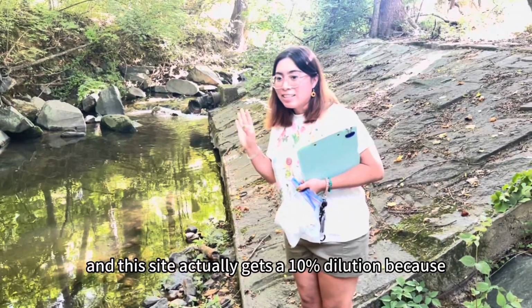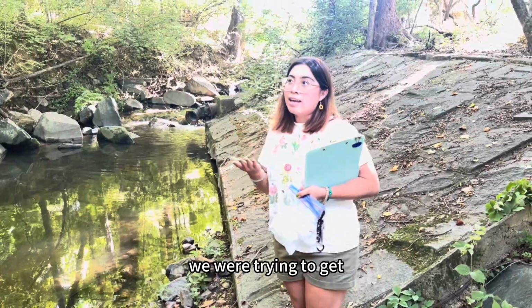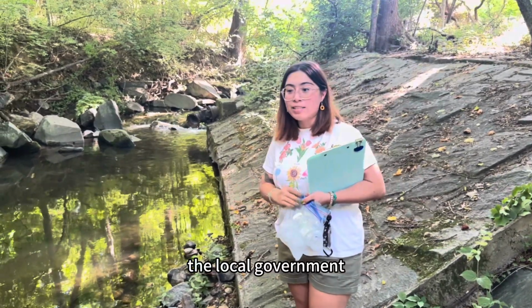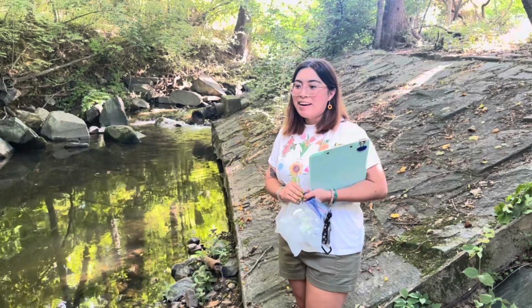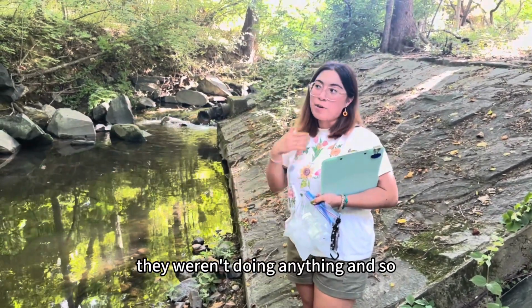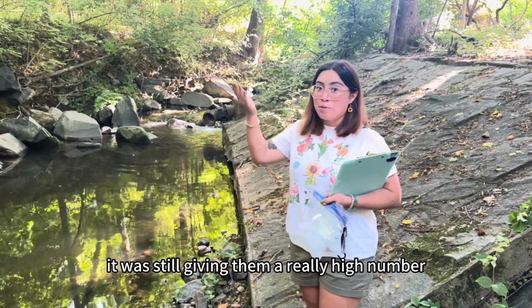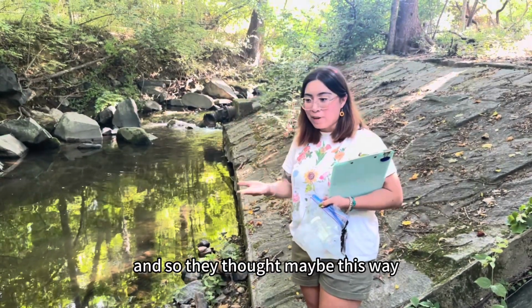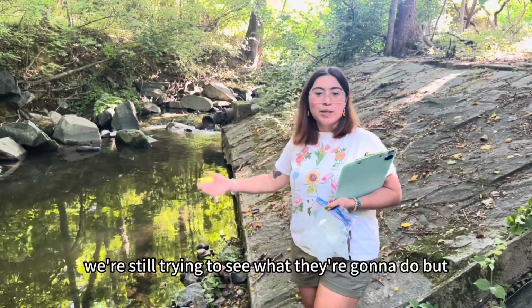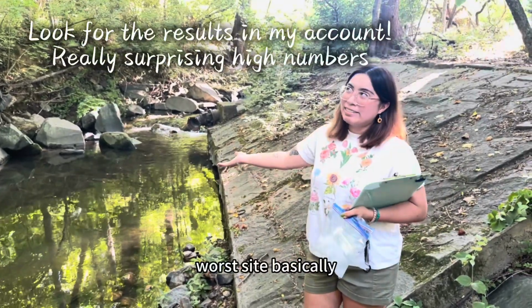This site gets a 10% dilution because Little Falls was trying to get the attention of the local government so that they can do something about it. Even though they were giving them high numbers, they weren't doing anything, so they decided that even if they diluted 10%, it was still giving them a really high number. They thought maybe this way they would do something about it. We're still trying to see what they're going to do. But yeah, this is our worst site basically.